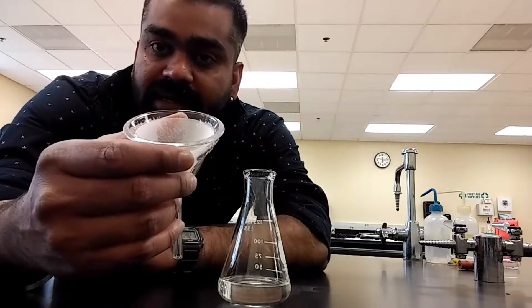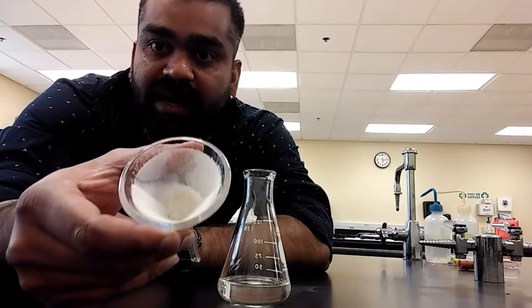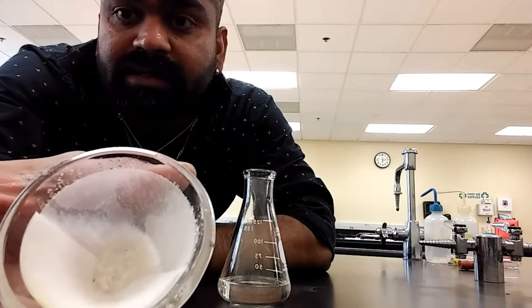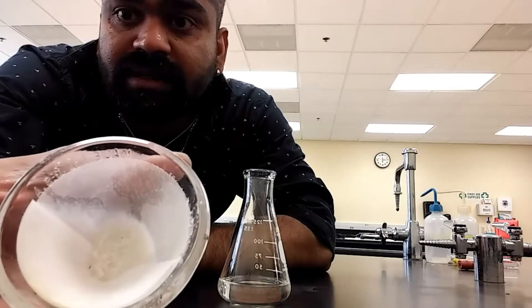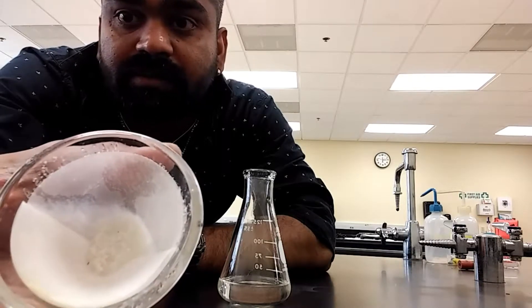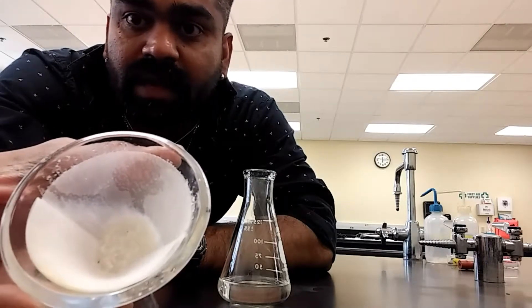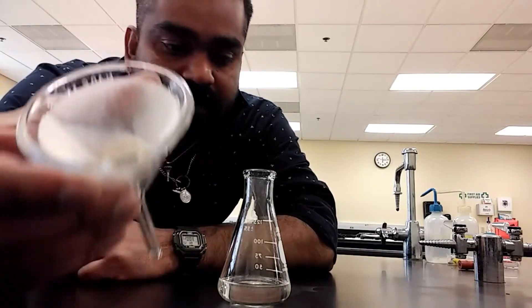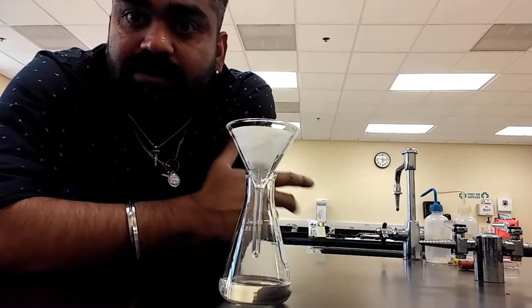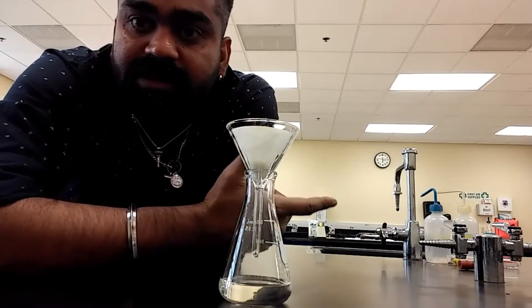I'm going to leave mine in the hood until students come back on Friday to do the lab. Take a closer look — you can see that white crystal. That's the adduct I was talking about; that's the product we're looking for. I think that's a job well done. Two key aspects to doing this lab well: first, make sure all your glassware is clean. I normally wash the glassware needed for that particular lab as an extra step just to make sure everything is clean.